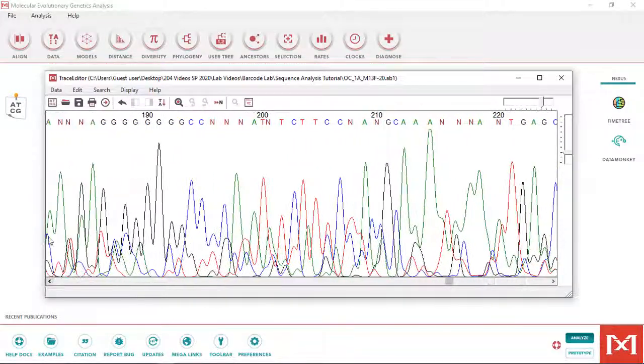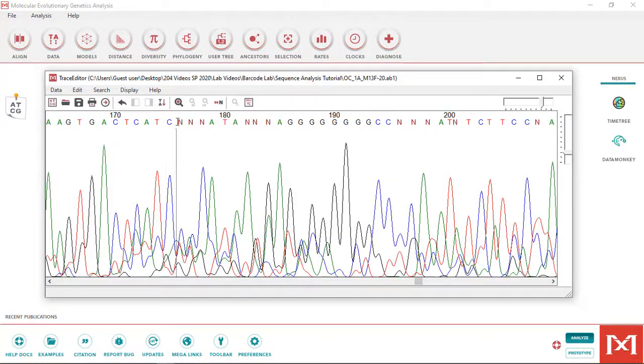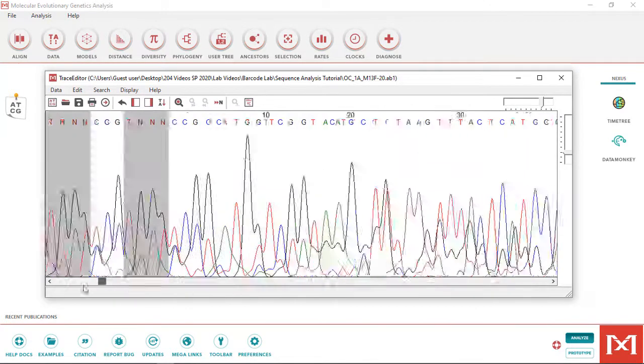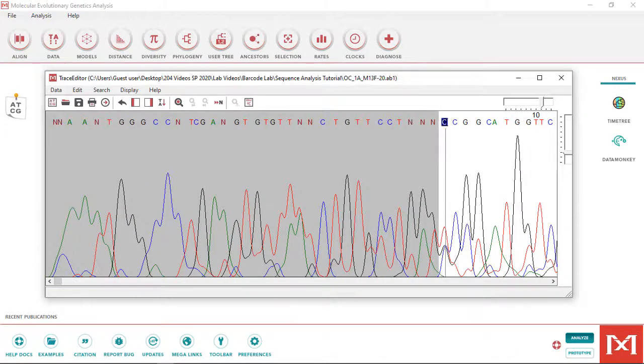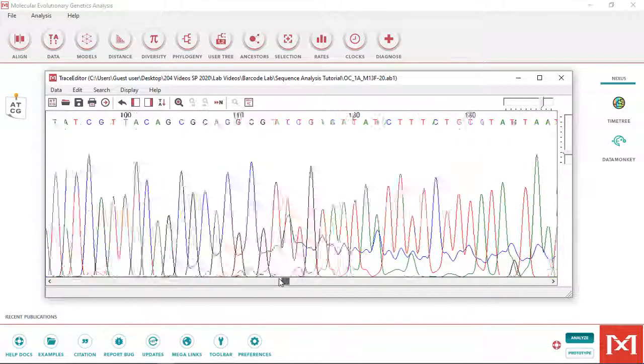Now position your cursor immediately after the masked sequence at the beginning and highlight the first nucleotide of good sequence. Then click this N icon to jump to the next ambiguous call in the sequence. Examine the peaks and see if you can confidently assign a nucleotide, and if you can, change the N to the appropriate letter. If not, leave the N there. Now this sample is pretty good, so there aren't any other ambiguous calls, but your sequence might have some.